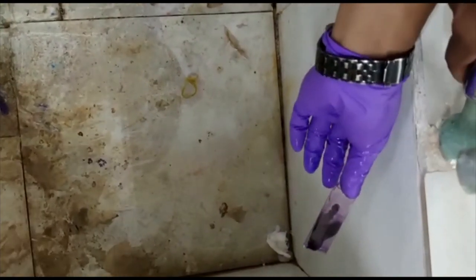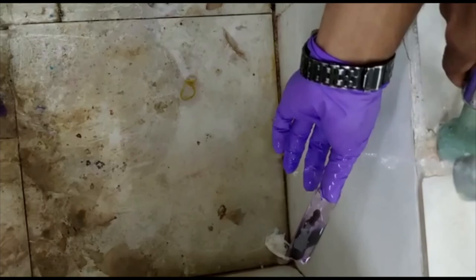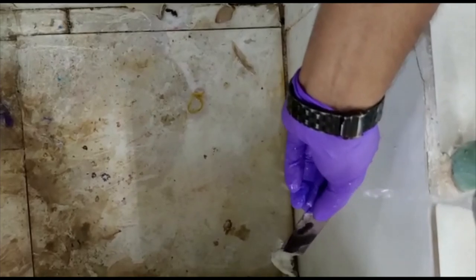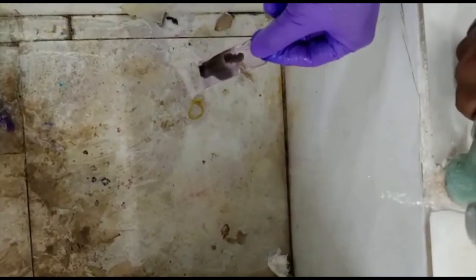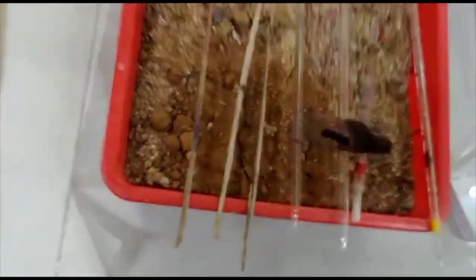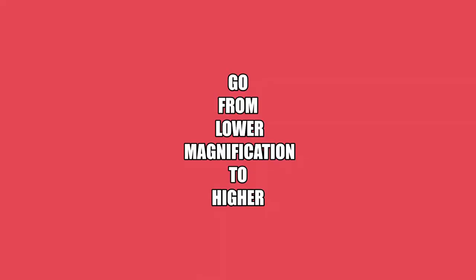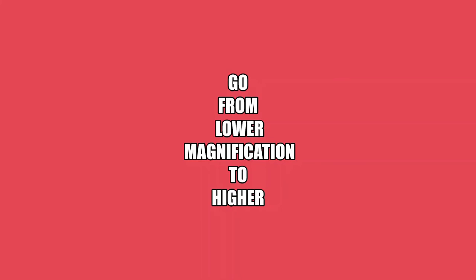Keep the slide to dry for some time before placing it under the microscope, because if the stain is still wet it might touch and damage or interfere with the lens. Once the slide is dry, view it under the microscope. Make sure you go from the lower magnification — say 10x — then increase to 40x. If you need to see the nucleus clearly, you can go to 100x with oil immersion.